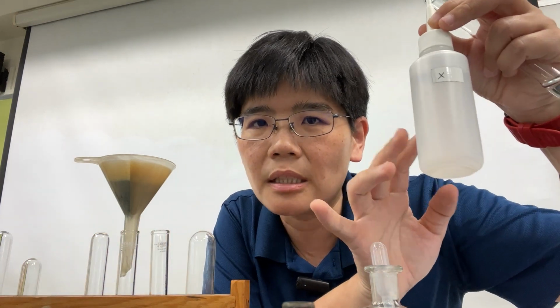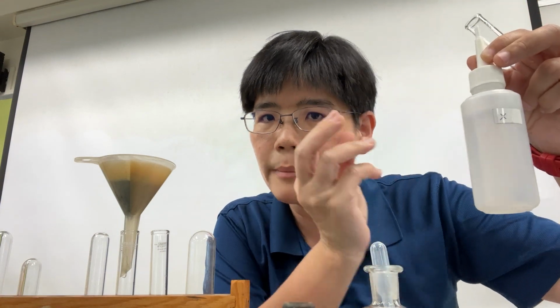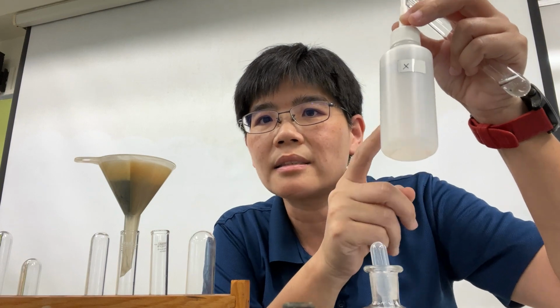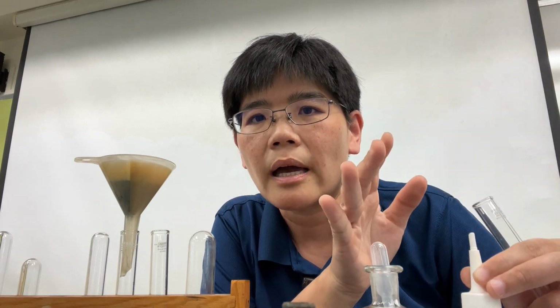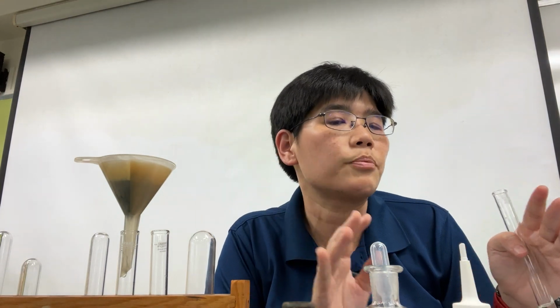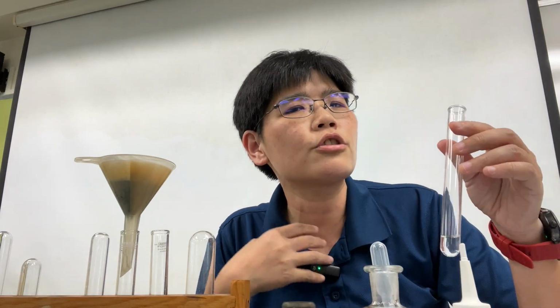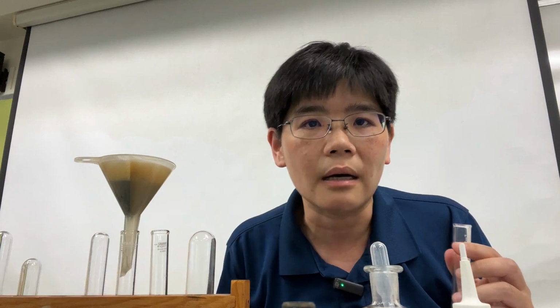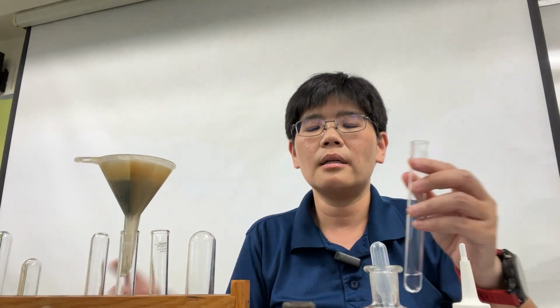Elemental metals are never solutions. So X is not a metal. Hence, I do not test for the presence of hydrogen gas. I now strongly suspect that the effervescence contains carbon dioxide gas. So I will put this aside.